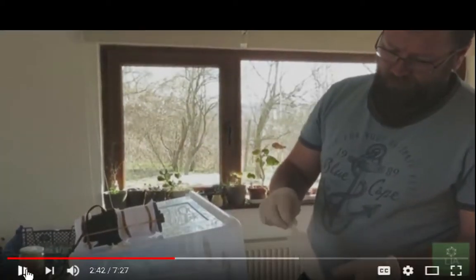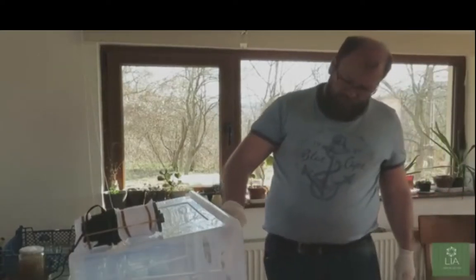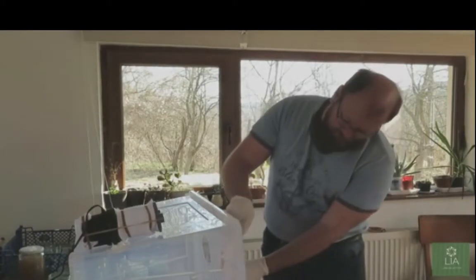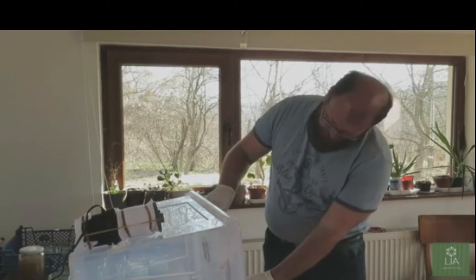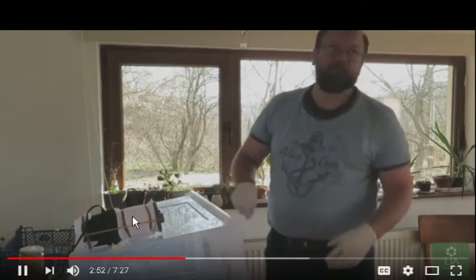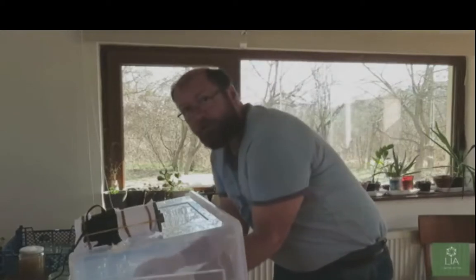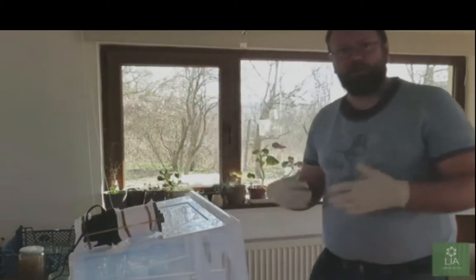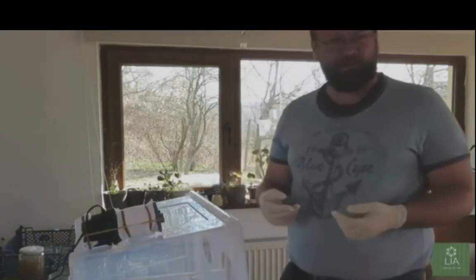And that's another reason why I'm not doing this airflow method, because I don't really want to listen to all that. The idea of this pump is to flow air, so we can see that there's air coming out through here and through here. This is showing us that there's clean air being pulled in, and we can work inside this environment without any contaminants.